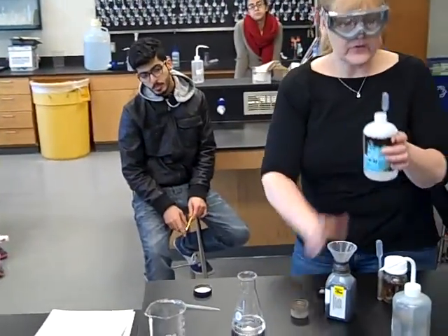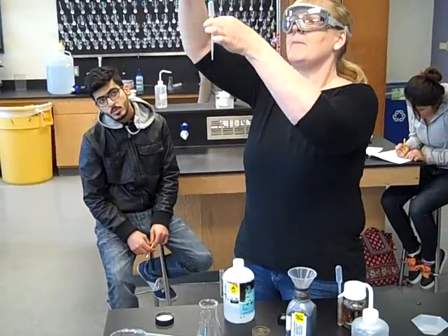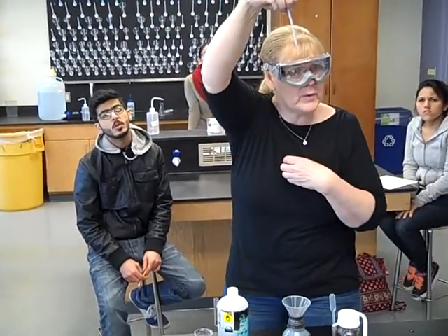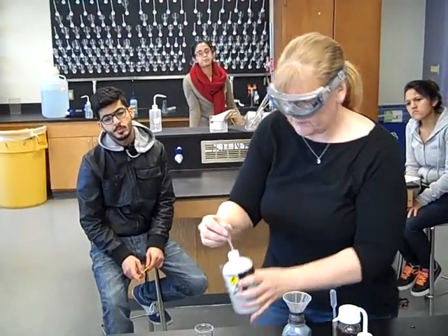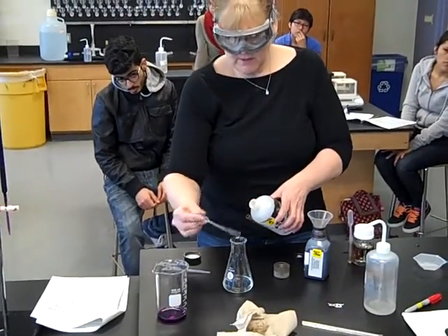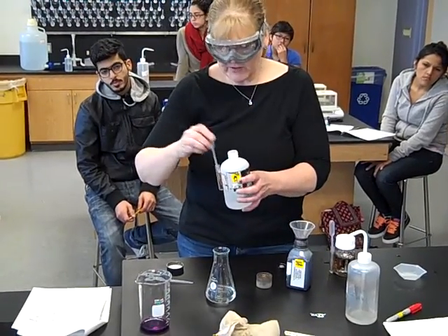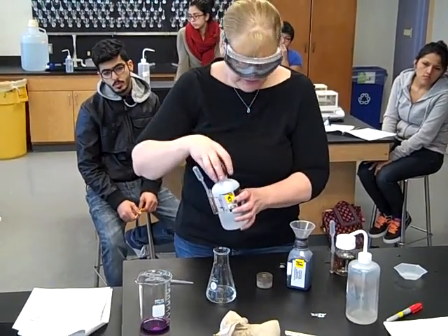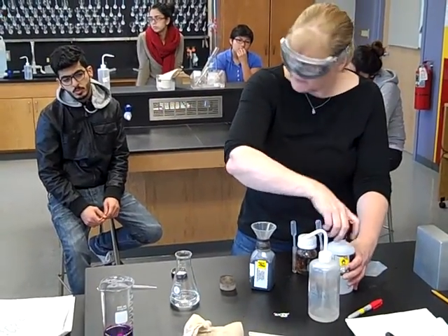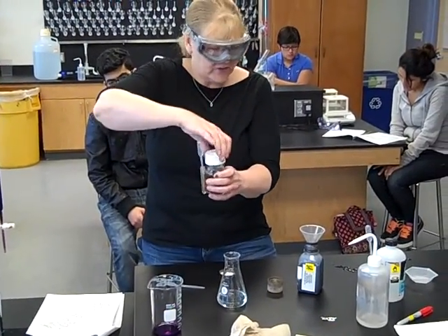We're going to use the little pipette that's on the side. If we fill from the bottom of the pipette to the bottom of the bulb where my fingers stop, that's one mil. So we're going to do that three times — one, two, three on the sulfuric acid. This does not have to be exact; we simply need an acidified solution. Then I'm going to add phosphoric acid as well — two mils of the concentrated phosphoric acid.